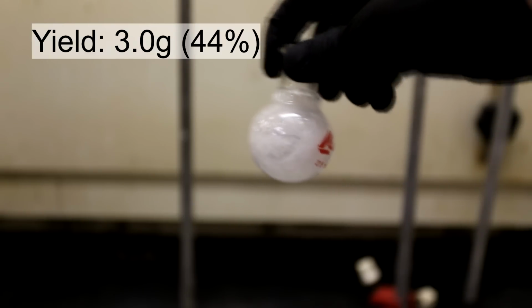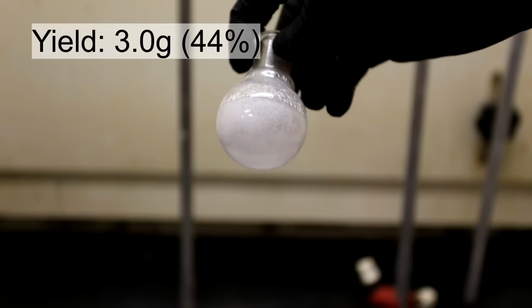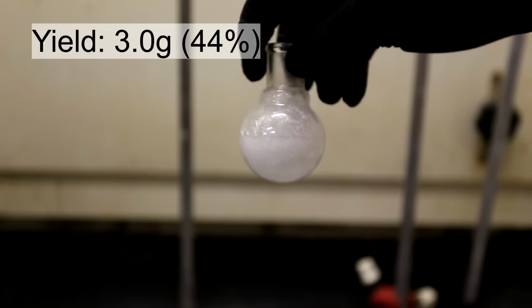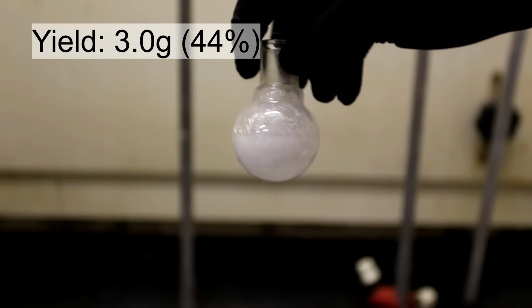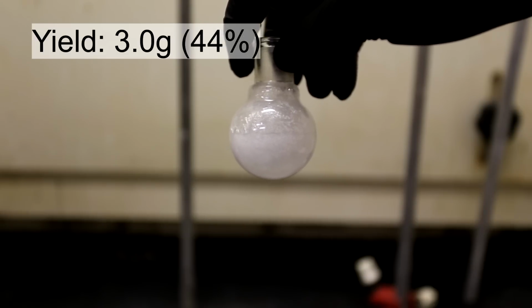When done on a larger scale, such as 20 grams and above, the percent yield will be much better, more likely around 70%. The largest loss was after the second distillation, where a lot of the phenol was left trapped in the distillation flask as well as the distillation apparatus.